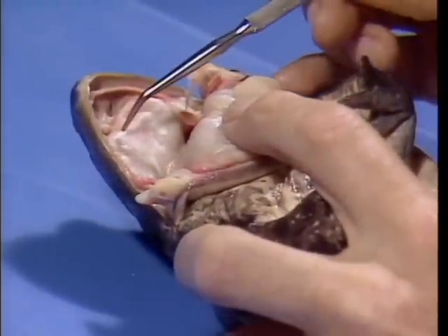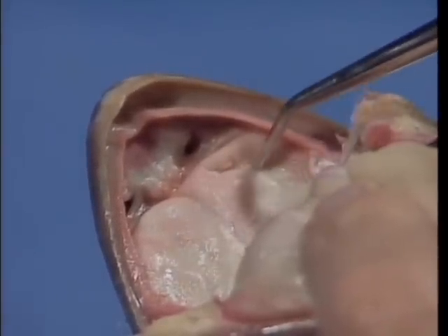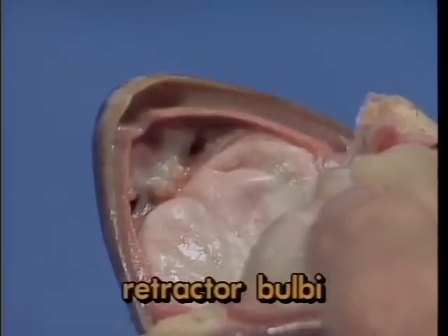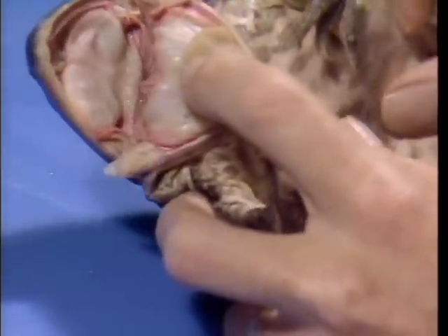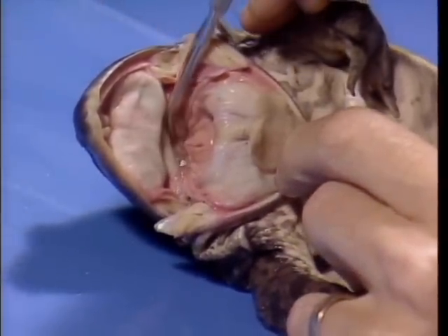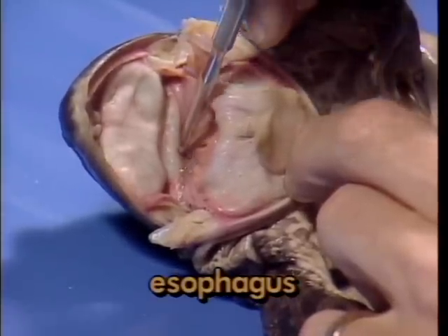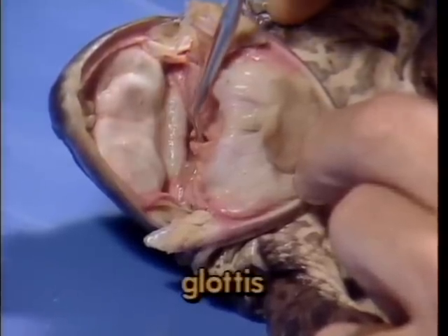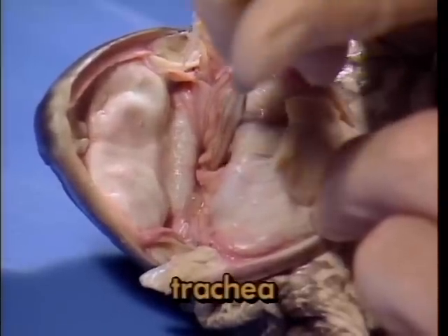The two areas in the back of the eye sockets, in the roof of the mouth, here and here, represent retractor bulbi muscles. Contraction depresses the eyes downward into the mouth cavity as an aid to swallowing. At the rear of the mouth cavity is a large opening, the entrance to the esophagus. The esophagus is the tube responsible for transporting food to the stomach. Just ventral to the esophagus is the glottis, an opening which leads to the trachea and eventually to the lungs.